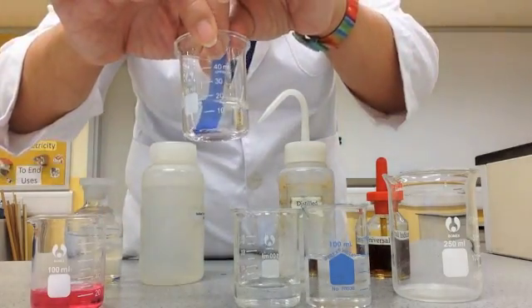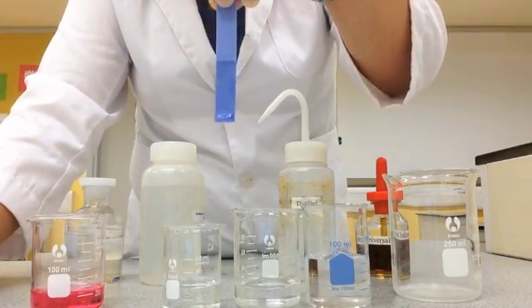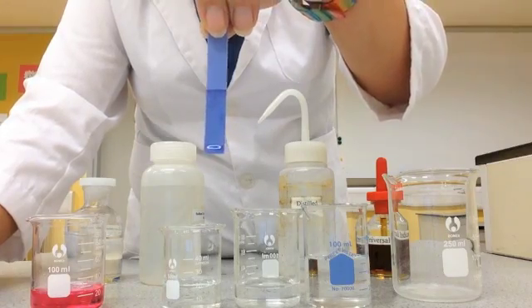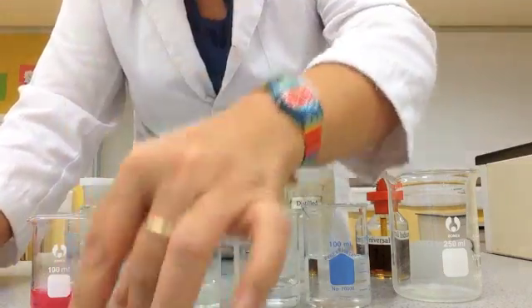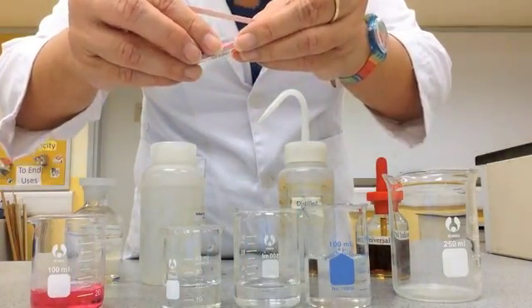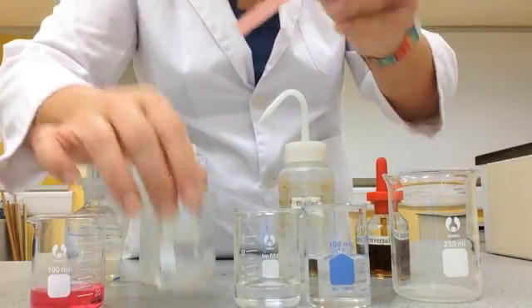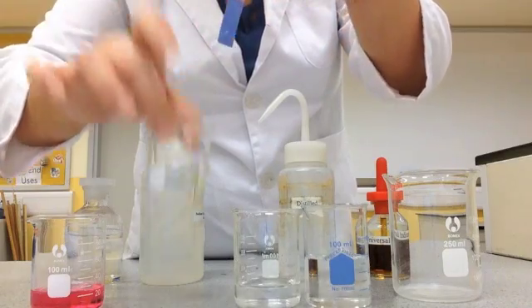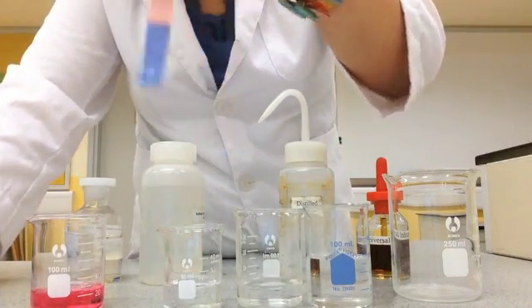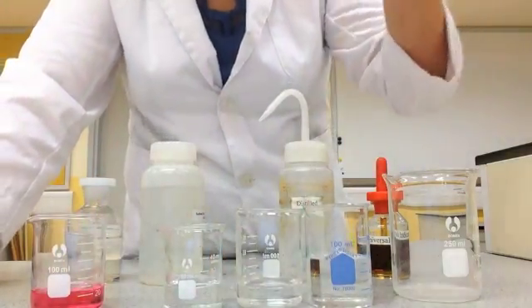Now let's look at this next substance. I dip the blue litmus paper and it remains blue. Can you assume it's neutral? No — you need to try with the red litmus paper. The red litmus paper turned blue, so this tells you that it is an alkali.